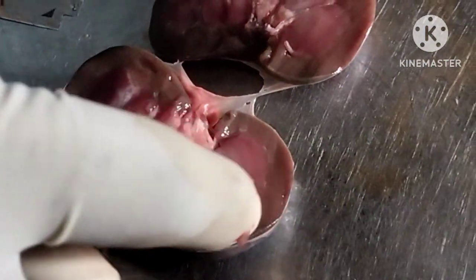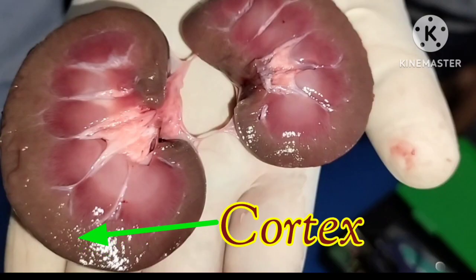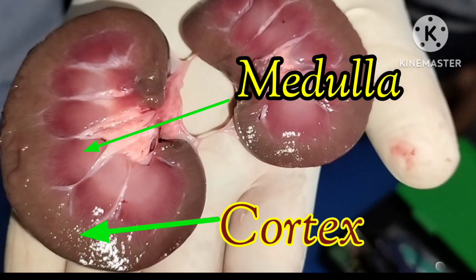Here you can see the dark color region. This is called renal cortex, and this lighter region is called renal medulla.